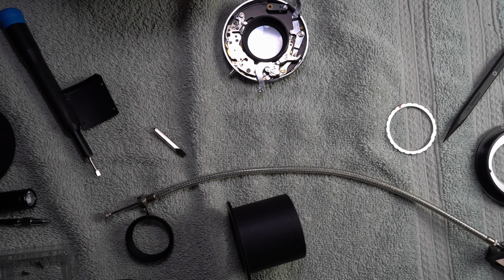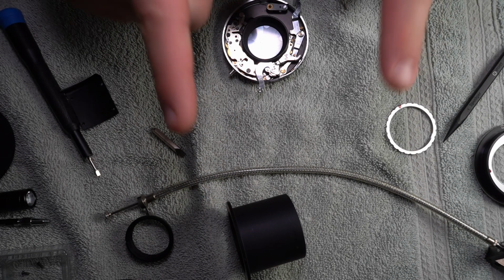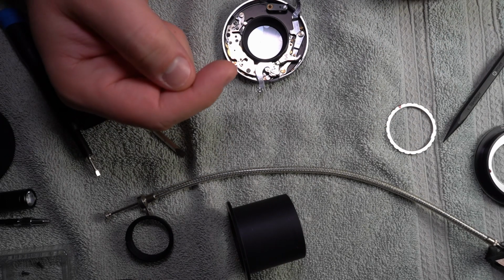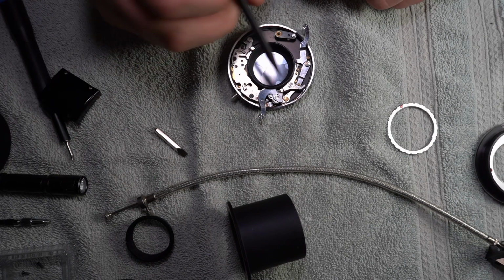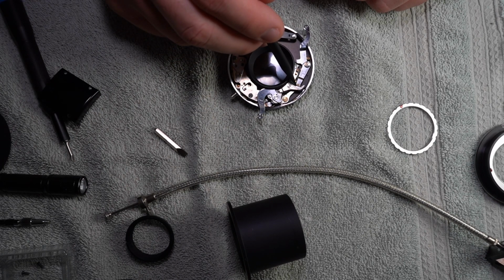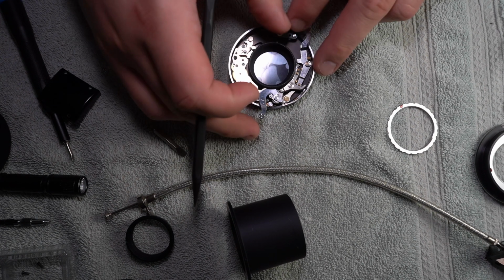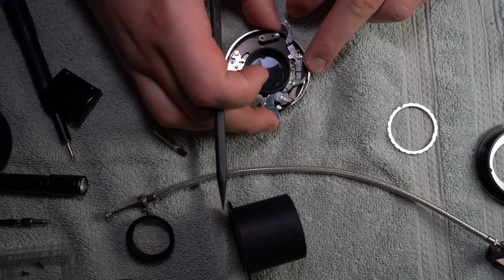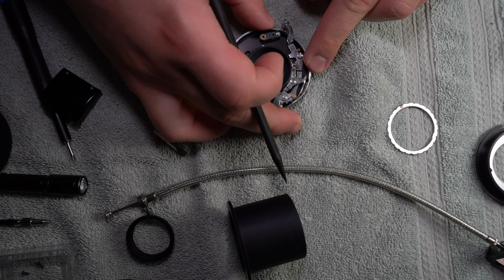I don't normally, but I've got a macro light up here above the camera, which I know is down, but you know. So I'm actually going to grease the face or the side of this thing here, and this, where is it? This part here.